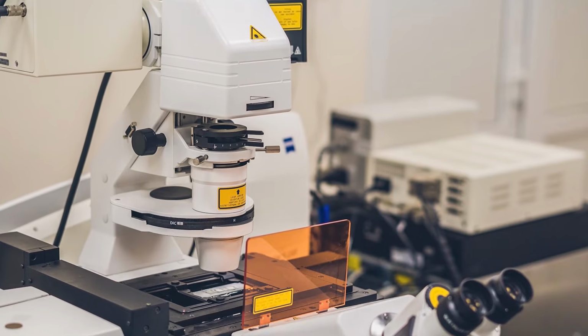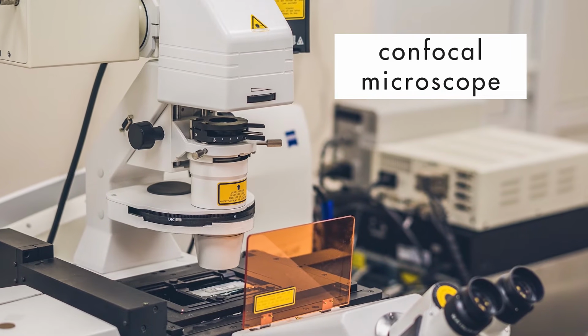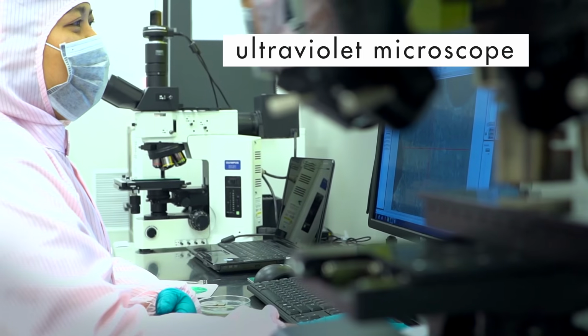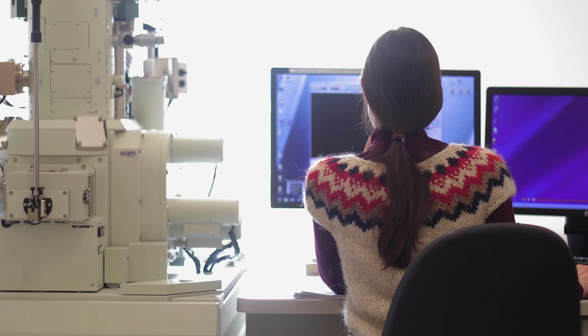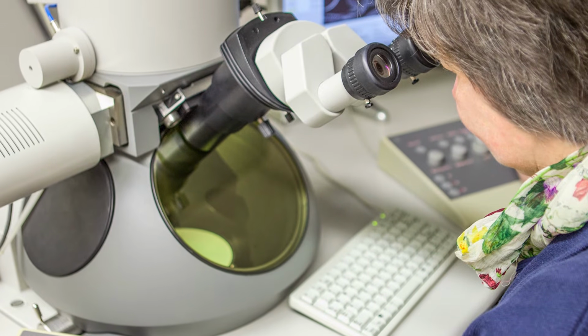Some other types of non-optical microscopes include confocal microscopes, which use laser light to magnify images, X-ray microscopes, which use X-rays, and ultraviolet microscopes, which use ultraviolet light. Modern non-optical microscopes can magnify an image of an object up to 10 million times. However, non-optical microscopes are large and extremely expensive, so they are usually found only in large universities and research laboratories.